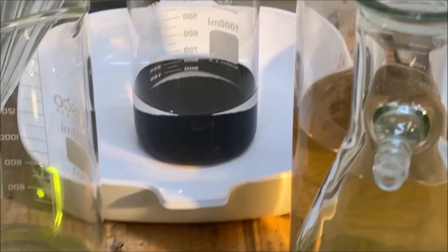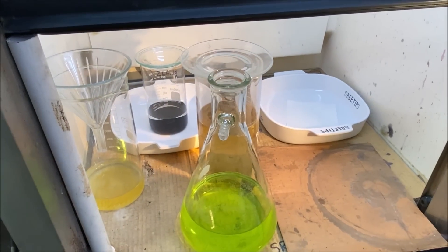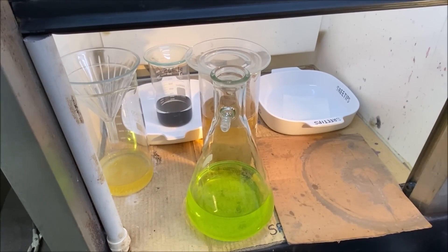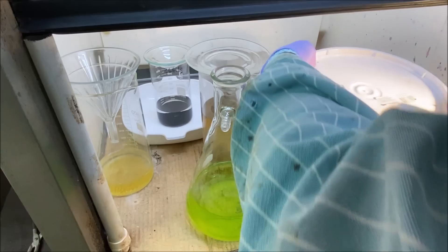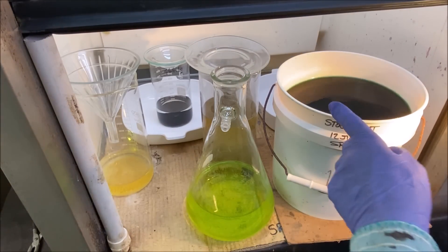But before I get going here, I've got some waste that I've accumulated. And what we're going to do is add this waste to my stock pot. But as you can see, my stock pot is full.